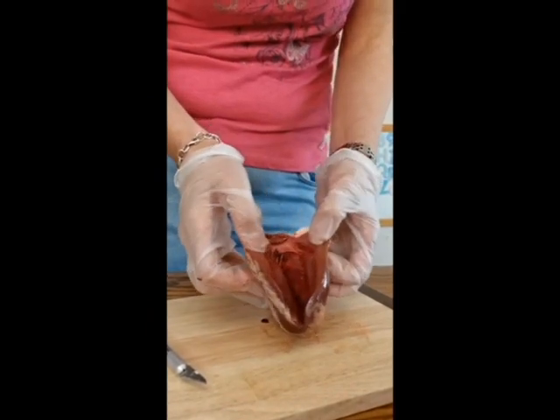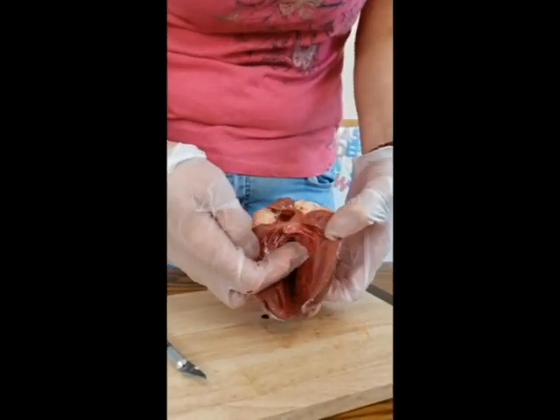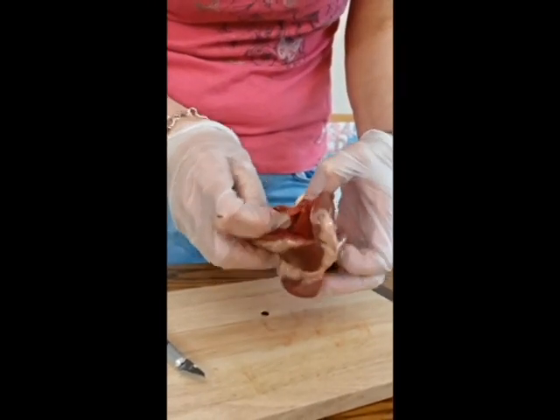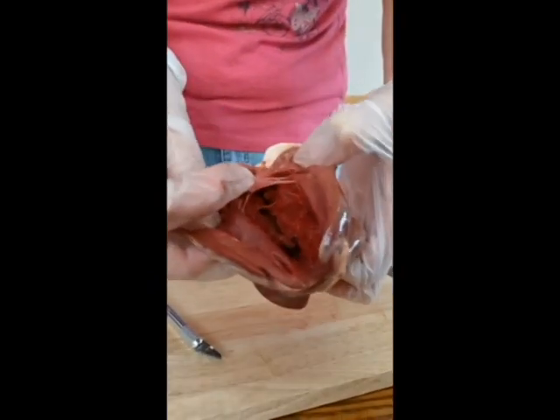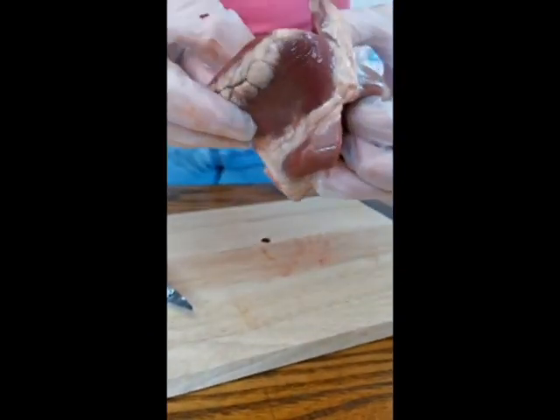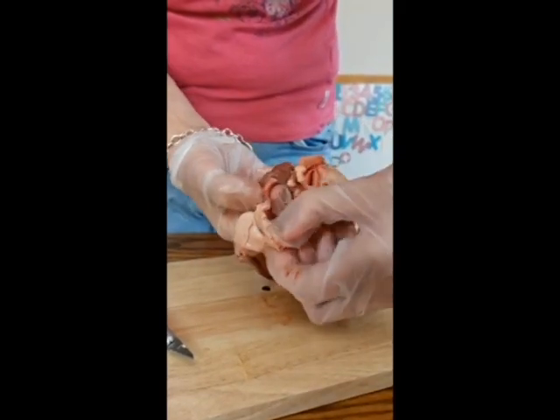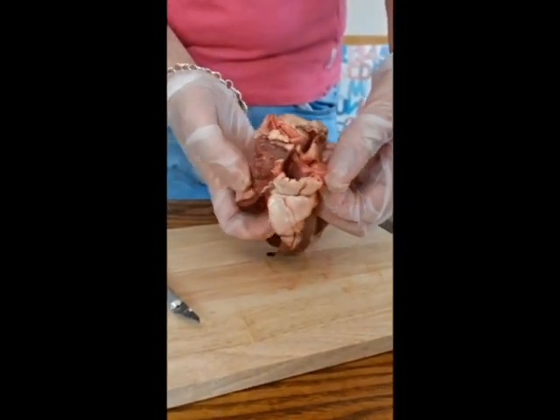Okay. You can also see the valves here. So again, you've got the tendons, the little strings, and attached to it are the heart valves. Okay, you've got 2 heart valves there. That one's opened up really nice. Can you see right inside there? Can you see 2? Okay, and then the blood would go up and out through a blood vessel. Now this blood vessel here, because the blood is going to go out, is called the aorta.